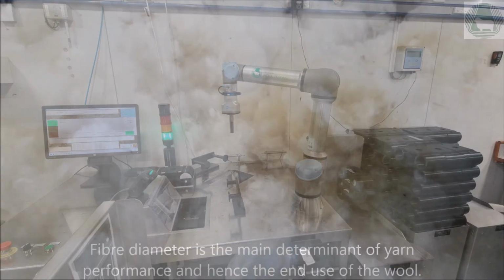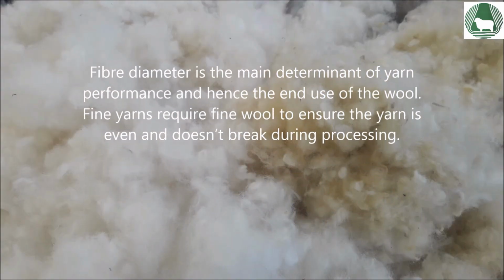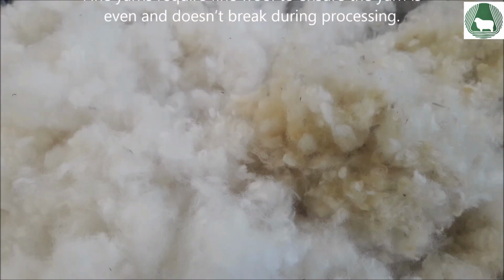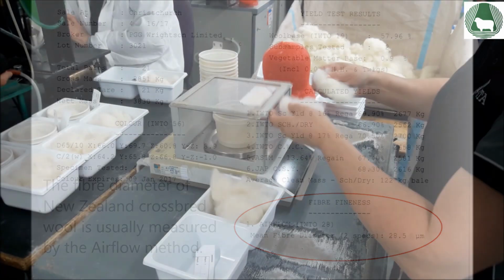Fibre diameter is the main determinant of yarn performance and hence the end use of the wool. Fine yarns require fine wool to ensure the yarn is even and doesn't break during processing. The fibre diameter of New Zealand crossbred wool is usually measured by the airflow method.